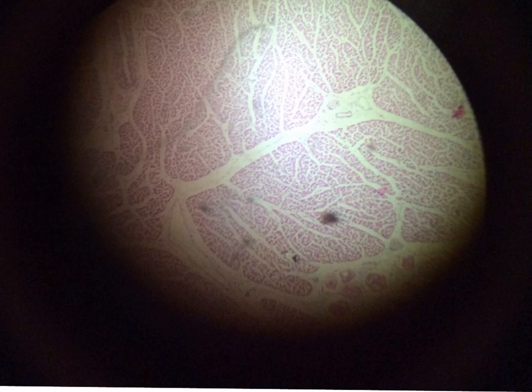Also, this is the slide for the moderator band, formed of one bundle, not many bundles, and inside the bundle you can diagnose these large fibers in a pale stained area, and these are the small cardiac muscle fibers present in this moderator band, with the separations of this white septa representing the connective tissue. And also you will find a large blood vessel, at least one blood vessel in this moderator band.